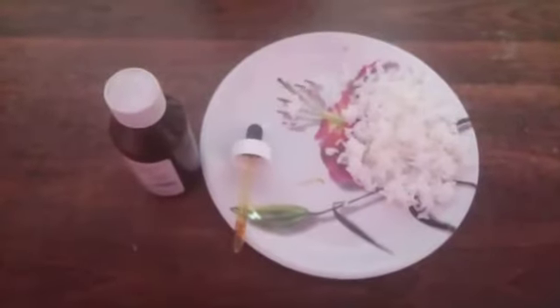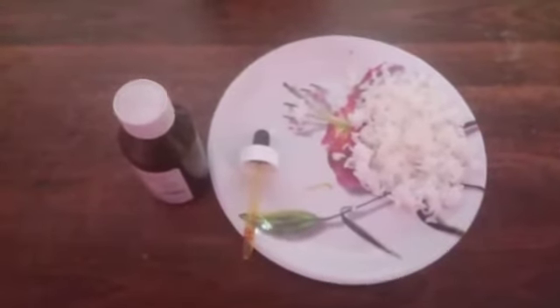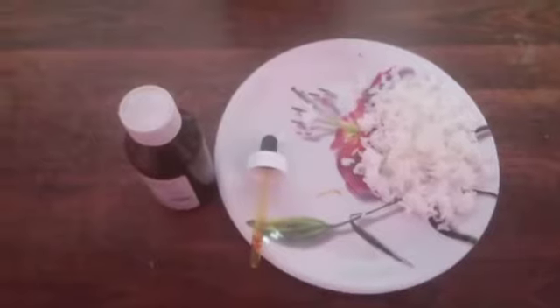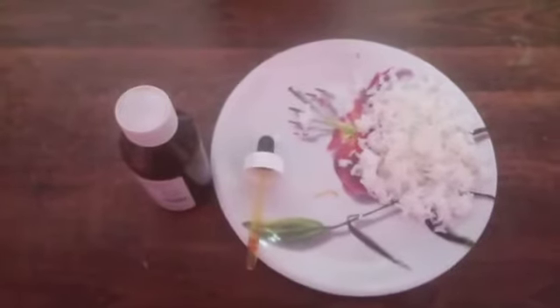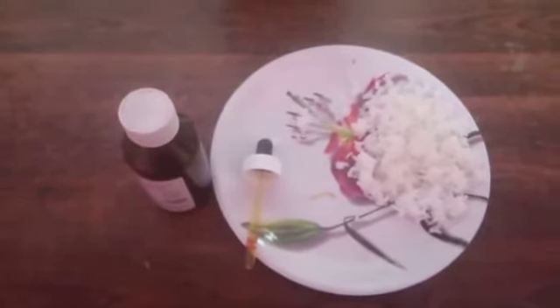Good morning ma'am. Myself Bin of the FM class 9. Today I am showing the presence of starch in the food sample. The materials required are iodine, dropper, and rice.